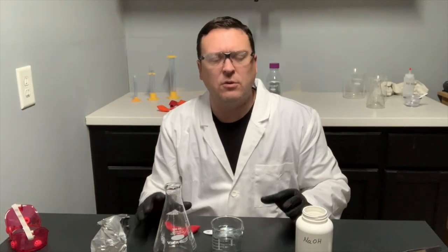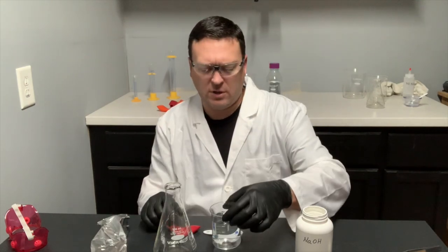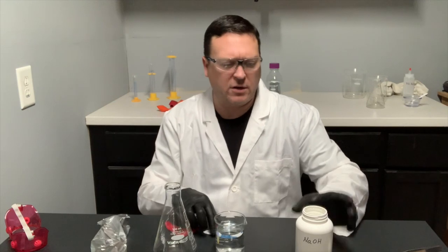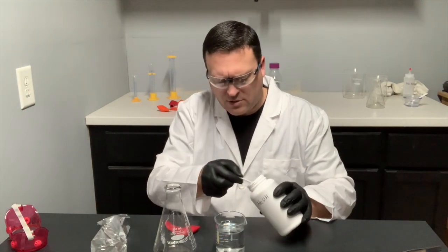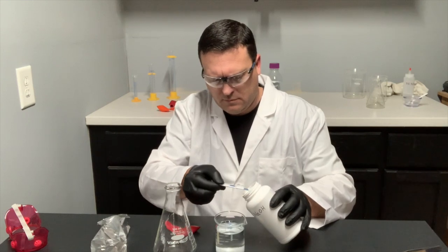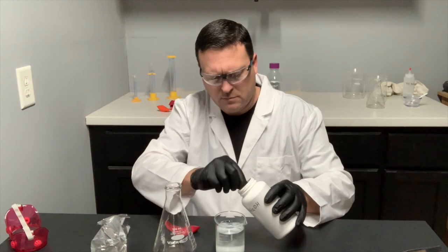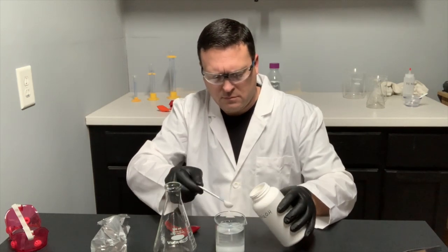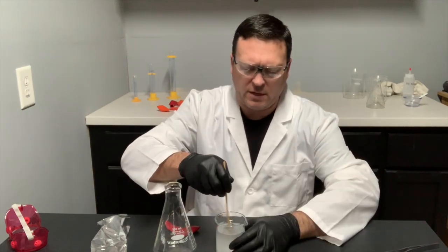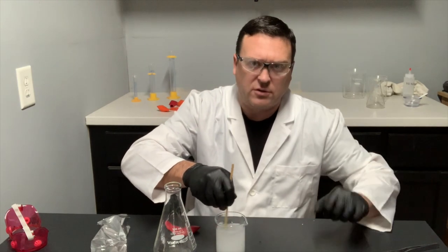Okay, so the first thing that I'm going to do is create a sodium hydroxide solution that I'm going to add to the flask. I'm going to take our 200 milliliters of water that we have here in a beaker, and I'm going to add sodium hydroxide.